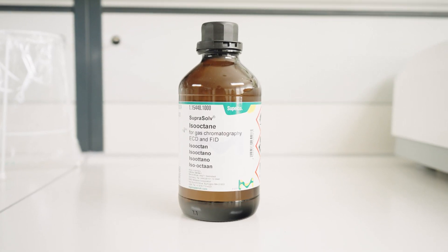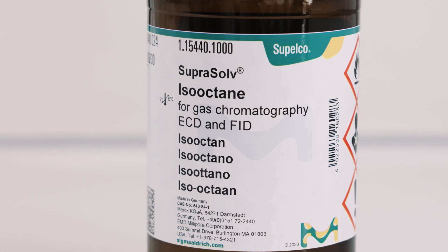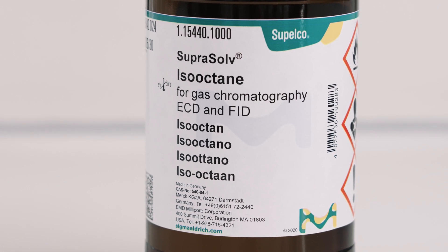Before getting into the preparation, verify the information in the solvent bottles and make yourself familiar with the risk and safety indications. Also, make sure you know how to dispose solvents, samples, and other materials.